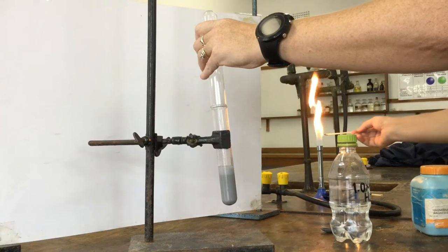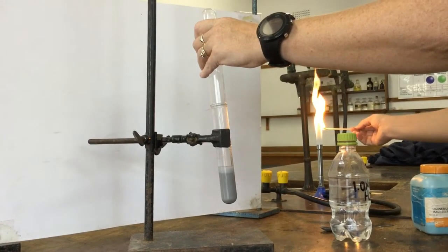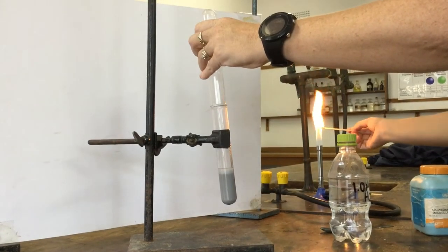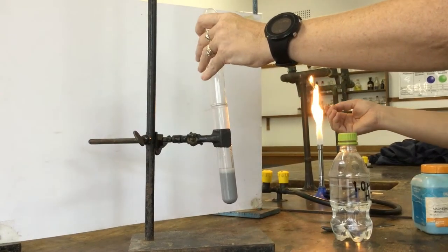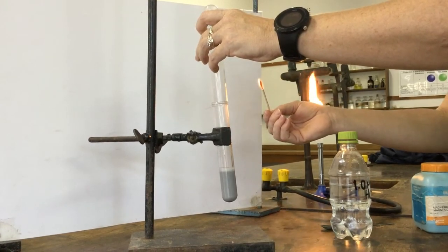Our test is it should cause a lit splint to explode with a squeaky pop.